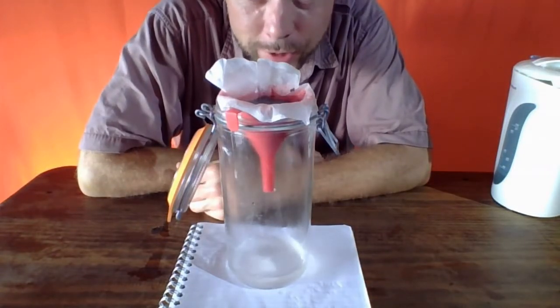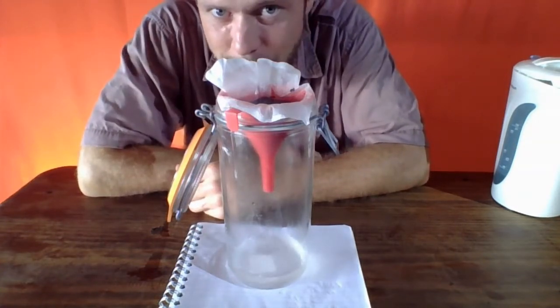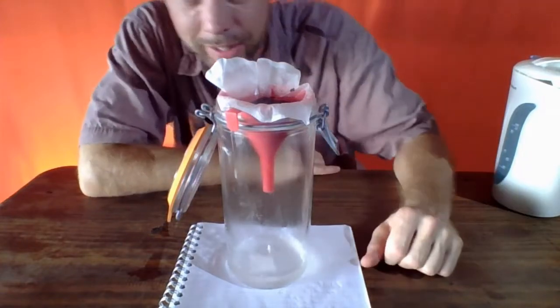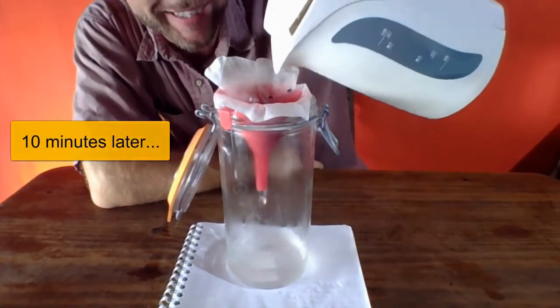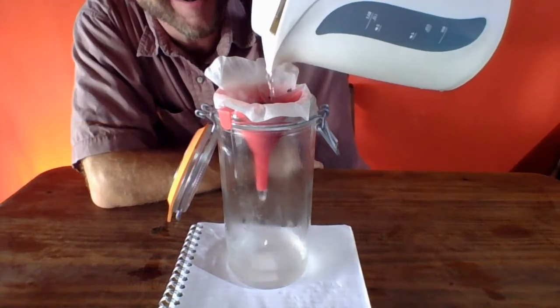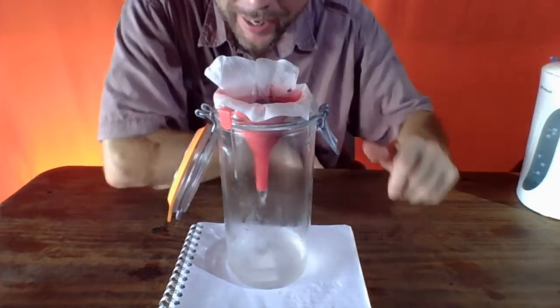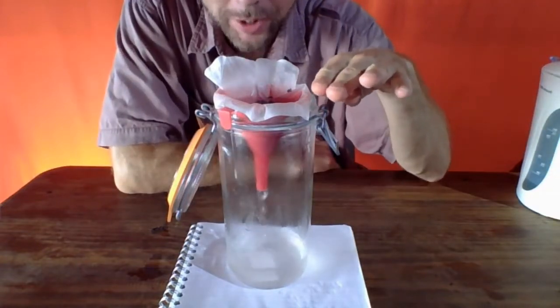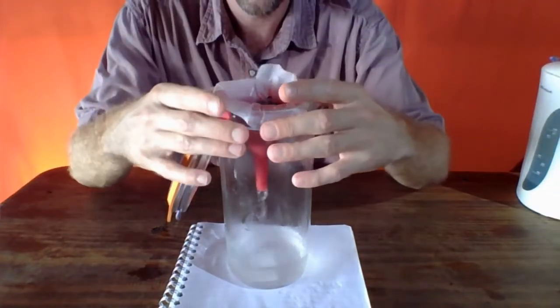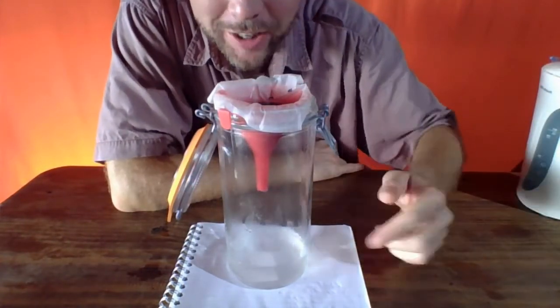So we're going to let this filter for a few more minutes. It's maybe going to take some 10 minutes or so of wait time until everything is down to the bottom. Okay, and it's looking pretty good. We're going to add a little bit more water and allow this thing to keep filtering. This might do it, as we're patiently going to wait here a few minutes for this water to drain, and there's still the water level up pretty high in the funnel.